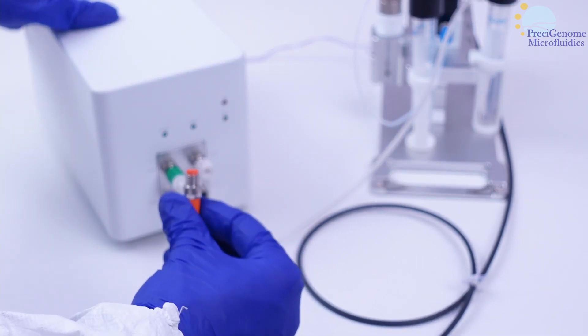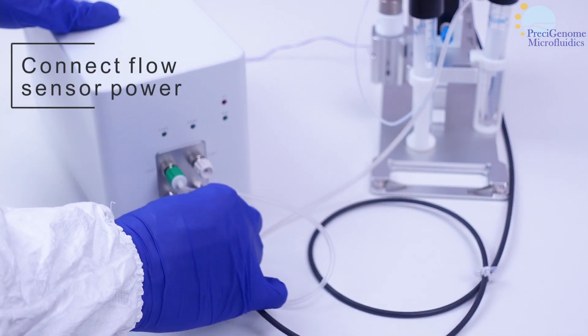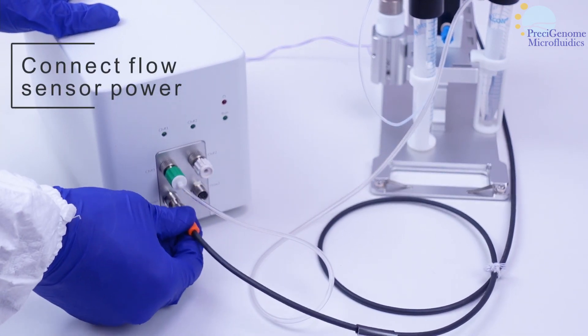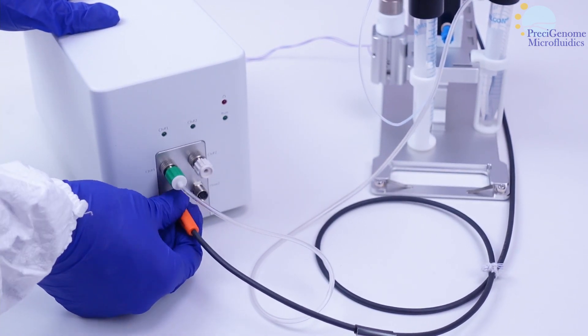Flow sensors may also be powered by the controller. These should be plugged into the same source as their connected reservoirs.